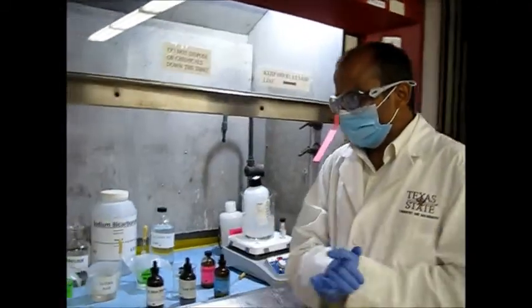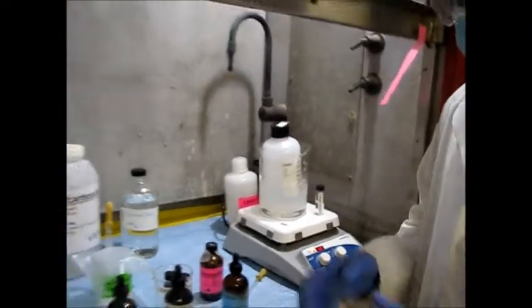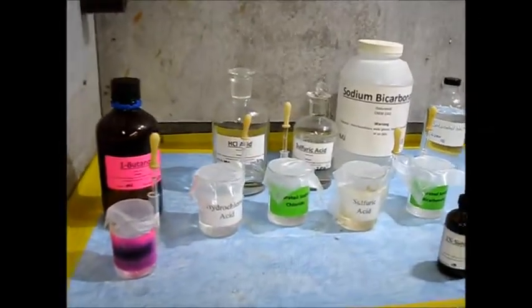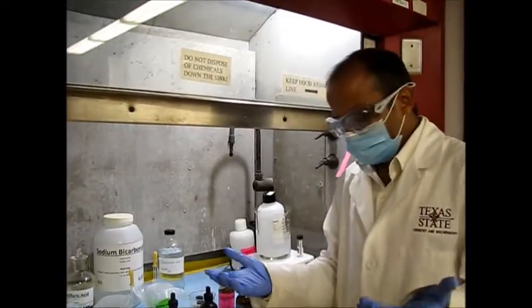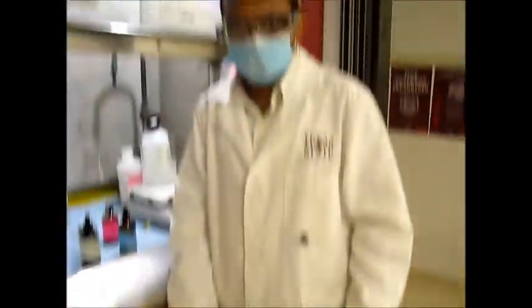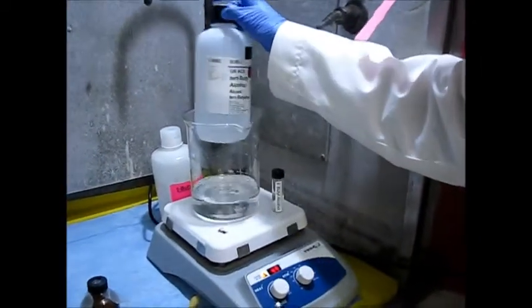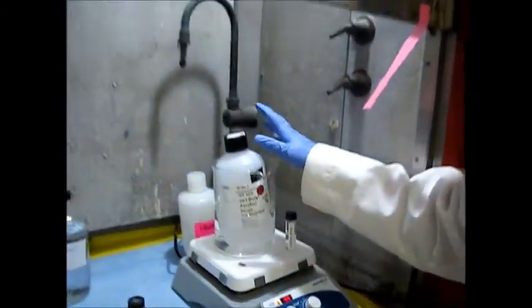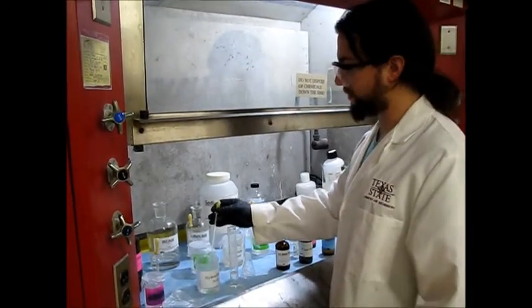For the SN1/SN2 reaction, the chemicals are located in the fume hood. Be careful working there — this is concentrated hydrochloric acid and sulfuric acid, so work very carefully and do not spill anything on your clothes. Always wear gloves, goggles, lab coat, and closed-toe shoes for protection. The tert-butanol remains solid at room temperature, which is why we kept it at 40–50 degrees Celsius so it can be weighed easily as a liquid.